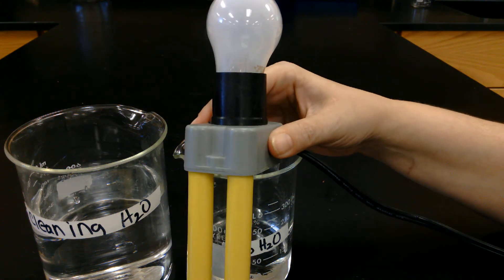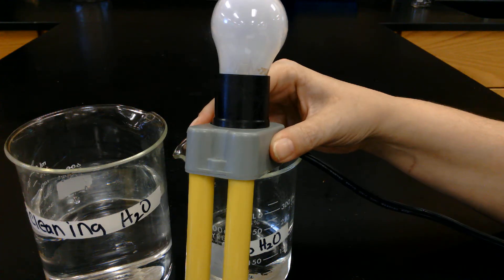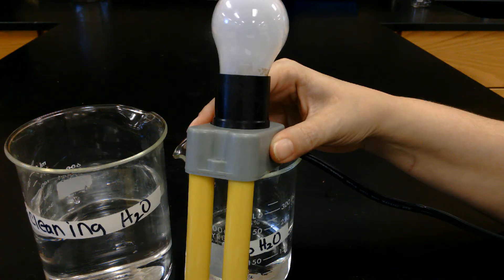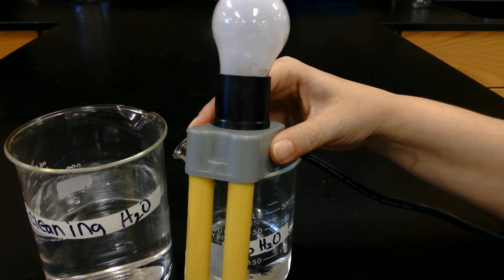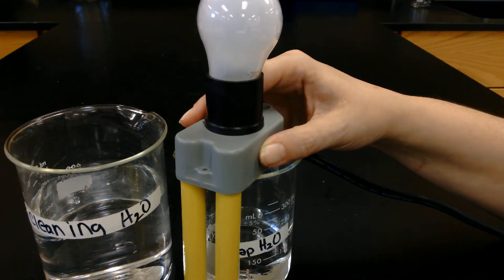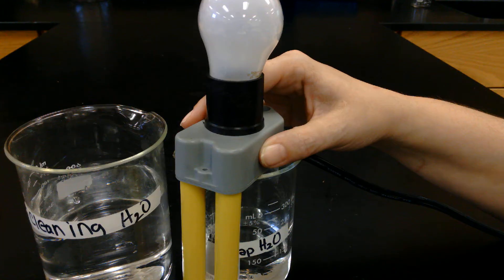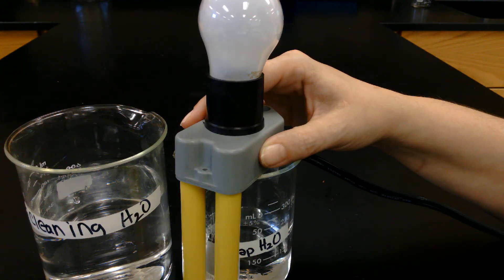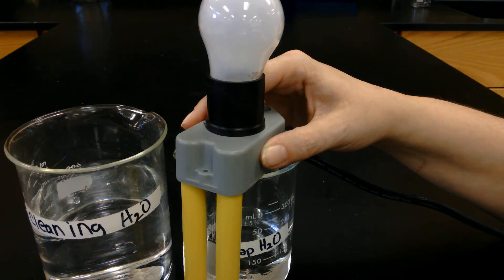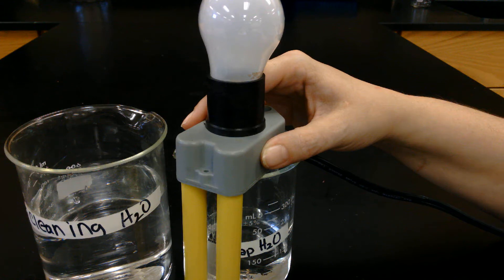This video is for the teacher-made lab that covers electrolytes versus non-electrolytes. We're going to test it with our handy-dandy little device that will indicate by glowing either very brightly or just a little bit to let us know if it's an electrolyte. According to Arrhenius, in order for a solution to conduct electricity and be identified as an electrolyte, ions must be present in solution and these ions must be free to move.